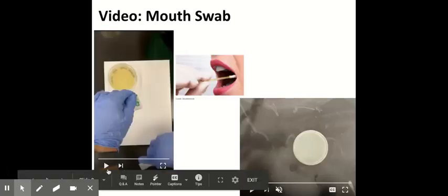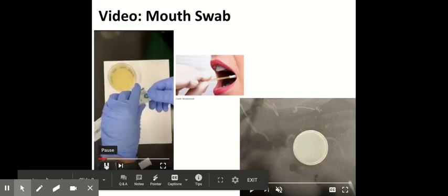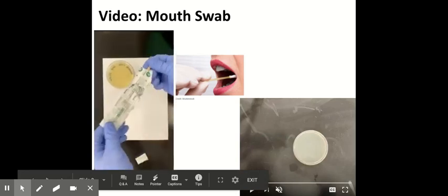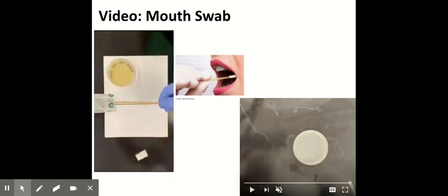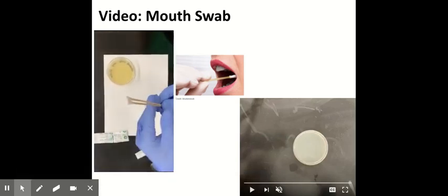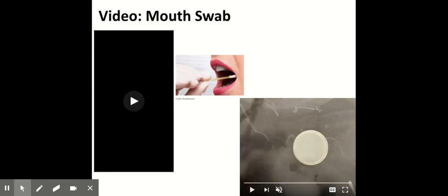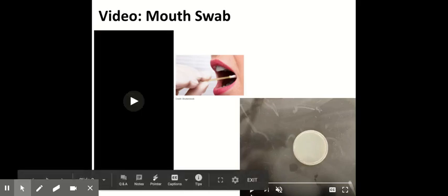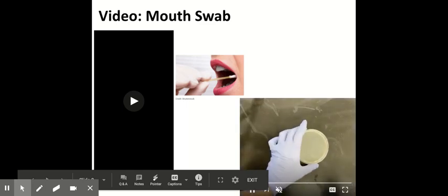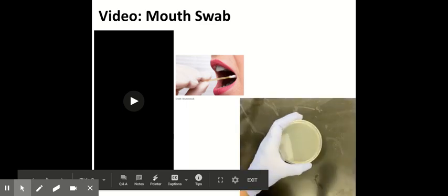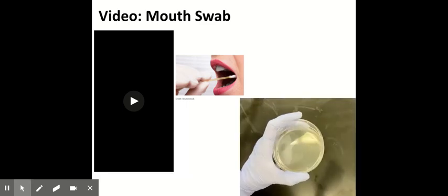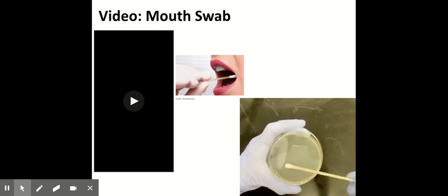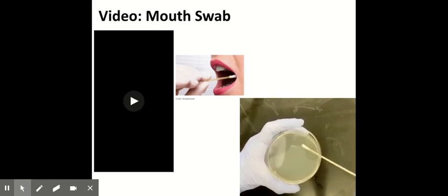This first video is to show you how to sterilely open a sterile swab, going through the paper without touching anything. And then you would swab the inside of your mouth and streak it onto the TSA plate, being very careful not to touch anything else, and gently streak it onto the agar.